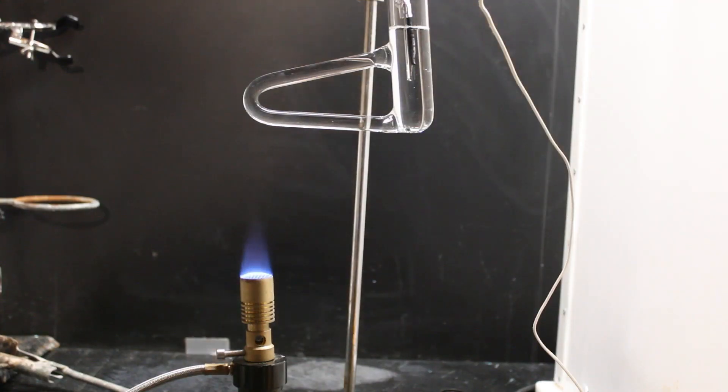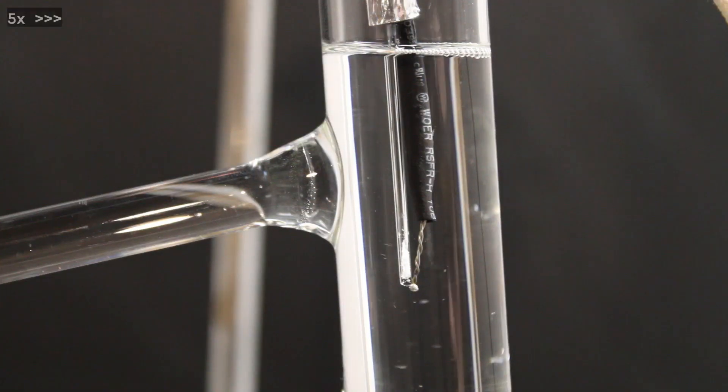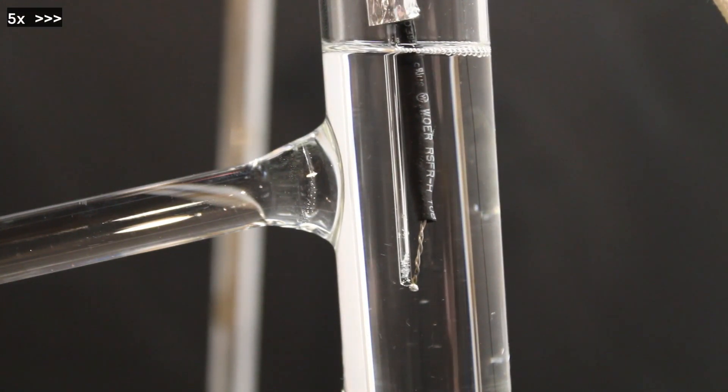Lastly, we will determine the melting point using a melting tube. We observe a range of 132 to 135 degrees Celsius. This melting point agrees very well with the published melting point for urea, which is 132 to 135 degrees Celsius.